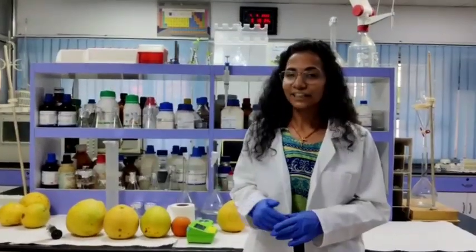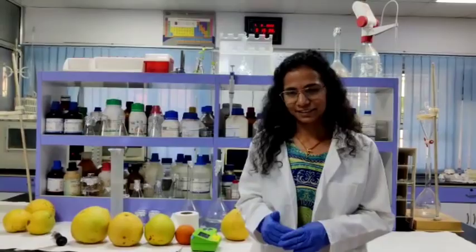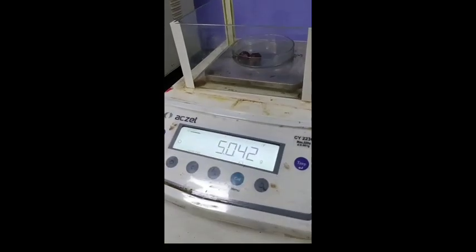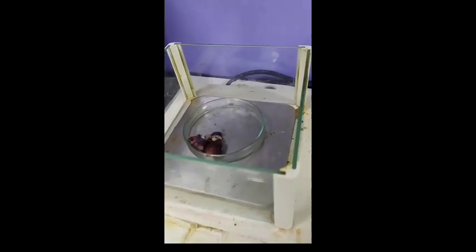Very good morning to you all. I would like to request Anshu ma'am to perform anthocyanin test. Hello everyone. Today we are going to see how to test anthocyanin contents in grapes.